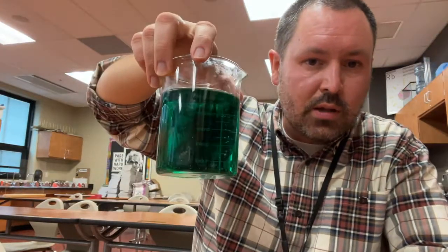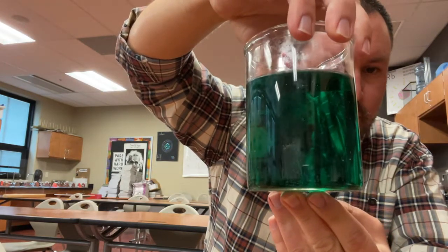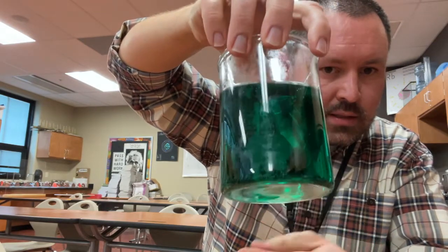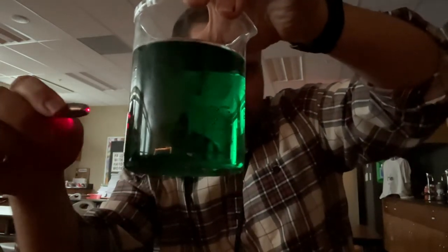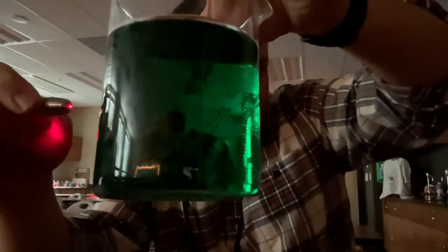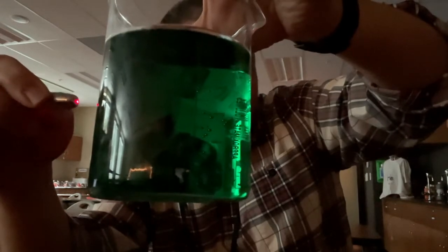The next one is food coloring and water. Here's our food coloring and water. It has not been stirred for a while. And since it has not been stirred, make some observations. What do you think about this one? We'll do the Tyndall effect next. But here is the water and food coloring. Let's go to the food coloring in the water. Can you see the laser beam in the food coloring in the water? I mean, sure, we can see a laser beam, but can you see it through the food coloring in the water? So that should give you a clue as to whether this is a solution or whether it is a colloid or whether it is a suspension.